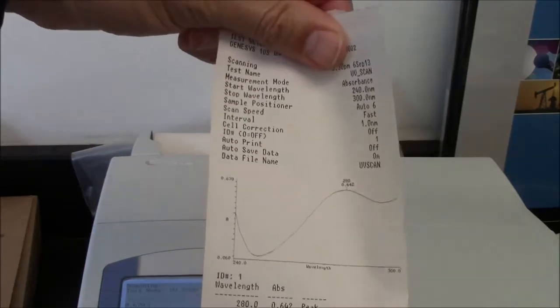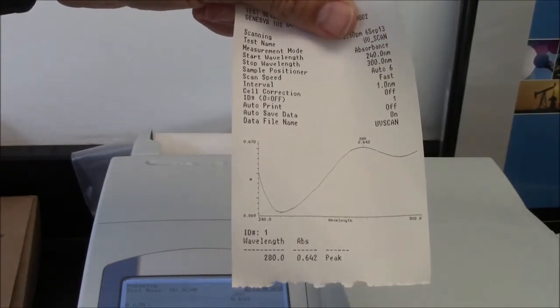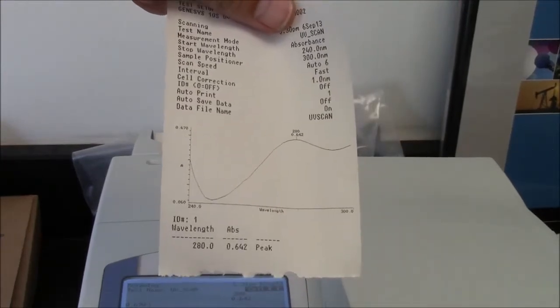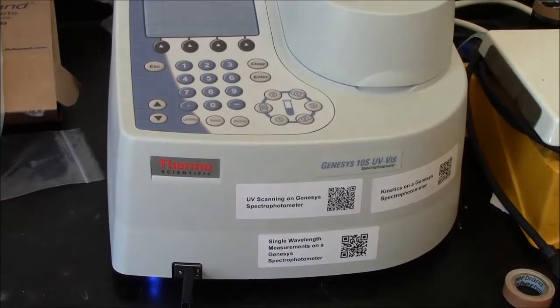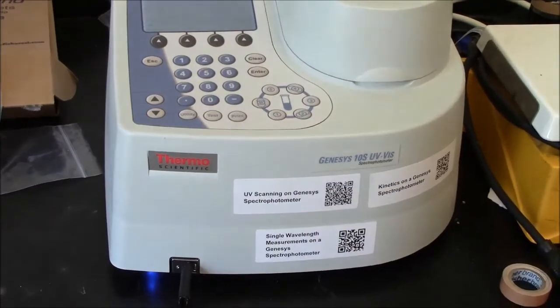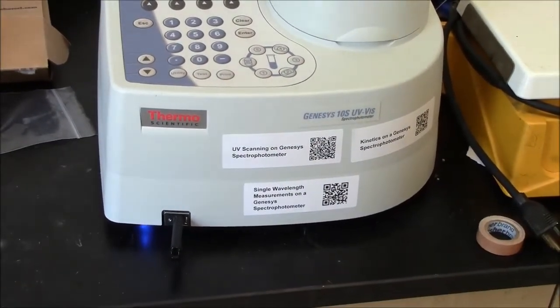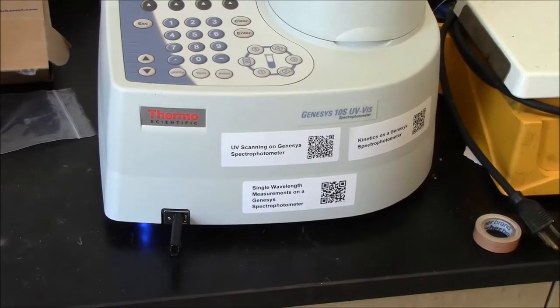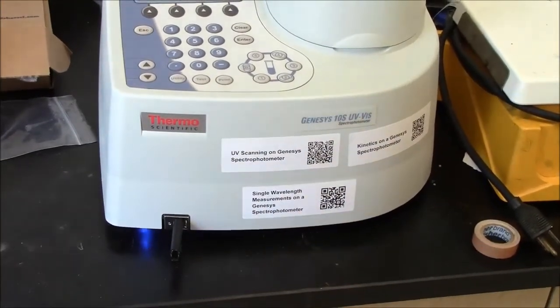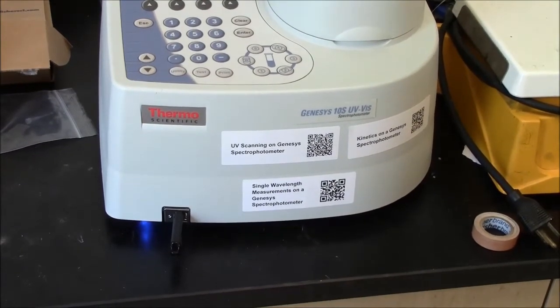And here is my data. Typically I would want you to scan this printout and share it with your team electronically. The data from that UV scan is automatically saved in this USB drive right here. If you want to make your graph look nice for presentation, you would take the data from this memory stick and process it on a computer.